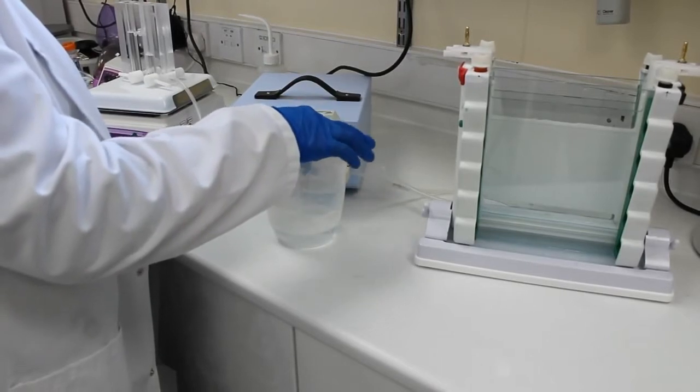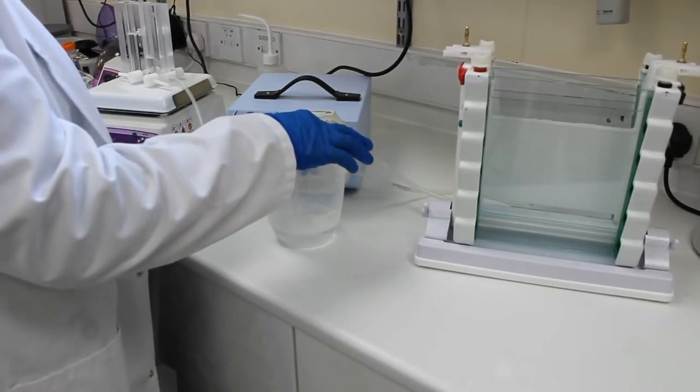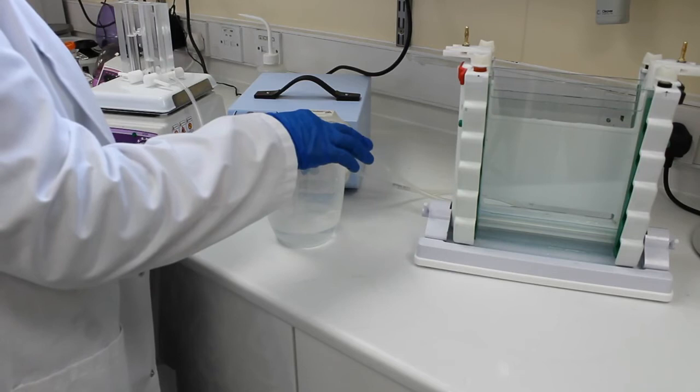So once you've finished the cleaning procedure of the gradient mixer you can move on to casting your second gel and the procedure is exactly the same as the first.